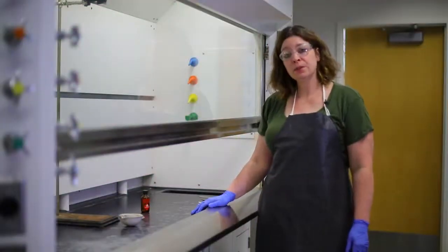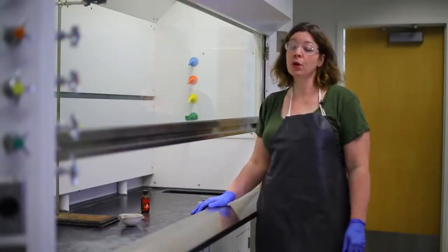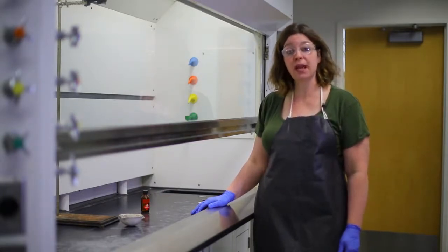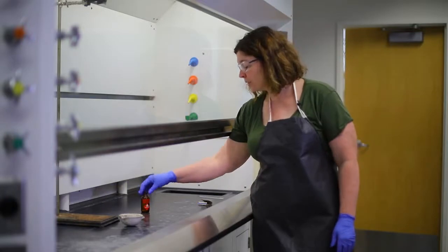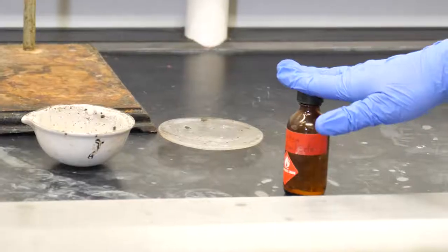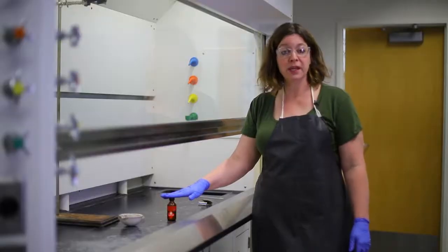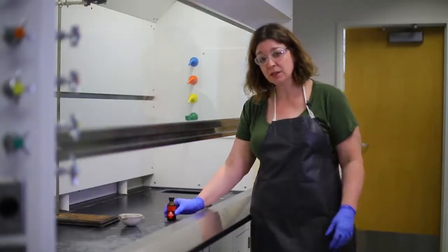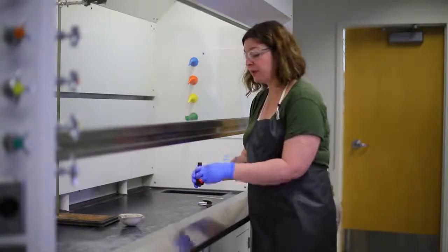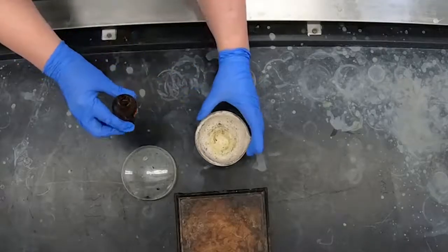In this flammable demonstration, we want to show you that you don't have to have an open flame or an electronic spark to make something catch fire. We're going to use a solvent called carbon disulfide. We don't use carbon disulfide very often in real life or in science anymore because it's a somewhat toxic substance, but it's extremely volatile and extremely flammable. It's very similar to gasoline in that respect.